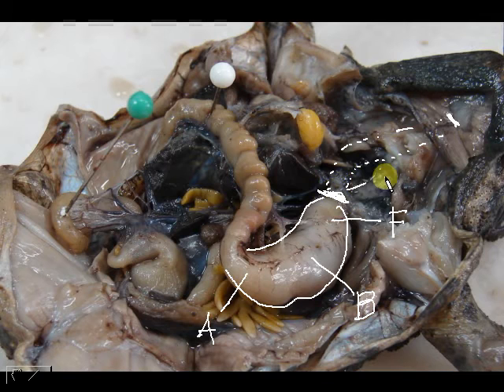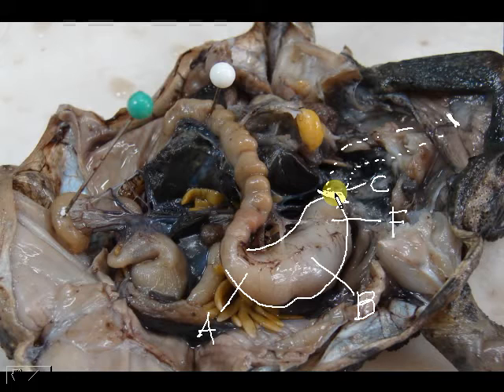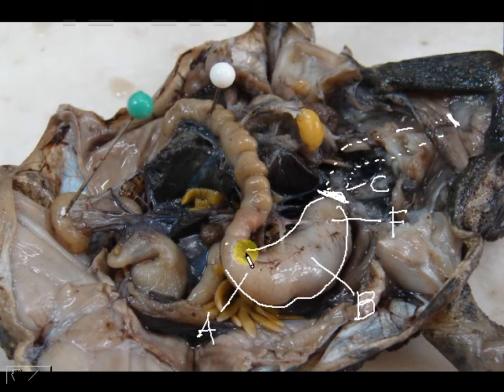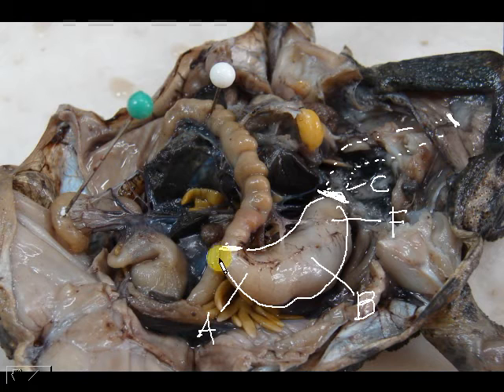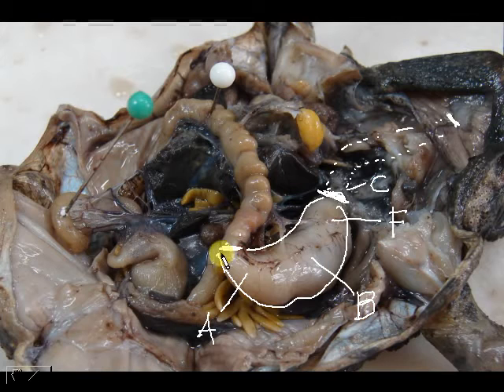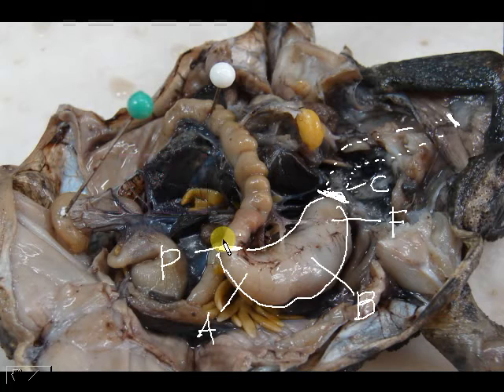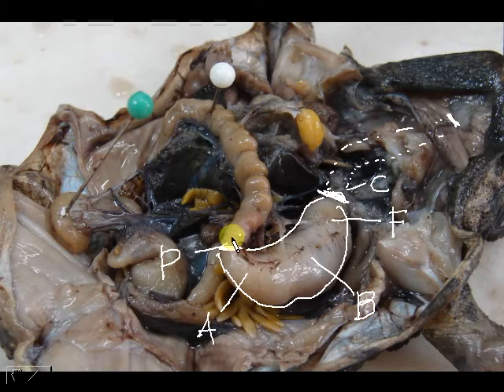Dividing the esophagus and your stomach, this region right here is called the cardia, and there is a sphincter there. A sphincter is a muscle that prevents the food from going back up the esophagus, and that sphincter is called the cardiac sphincter. The same goes for when the stomach meets the small intestine — that region is called the pylorus, and there is a sphincter there called the pyloric sphincter, which prevents the food from going back to the stomach and vice versa.